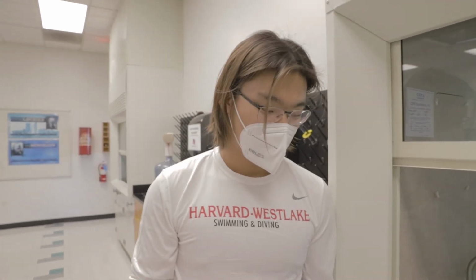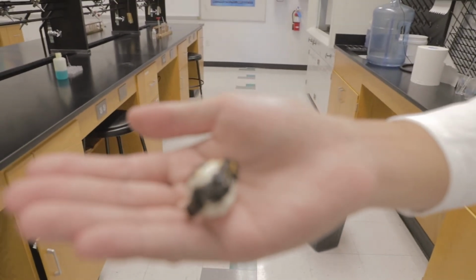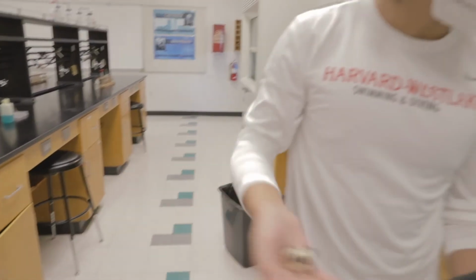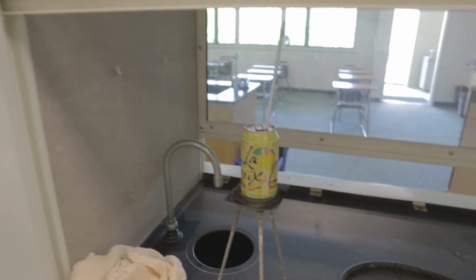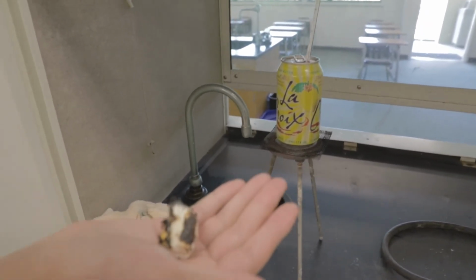Alright, so as you guys saw in that wonderful video, calorimetry can be used to determine how much energy is stored in your food. Calories, anyone? So that's what we're going to be doing in the lab today. So as a sample, we have this beautiful, nicely delicious, fluffy marshmallow. And by burning this marshmallow in this calorimeter, we will be able to find the Q value, the total energy released, and from that we can calculate the calories per gram.